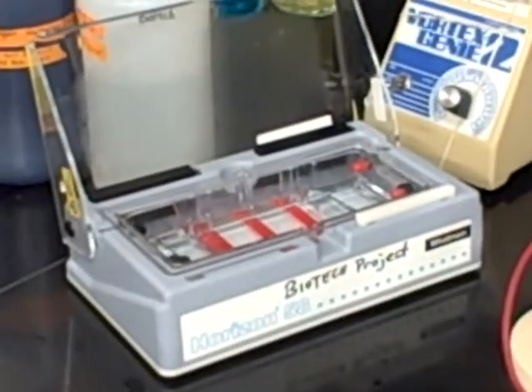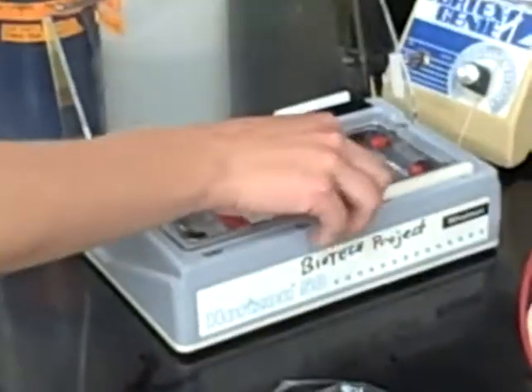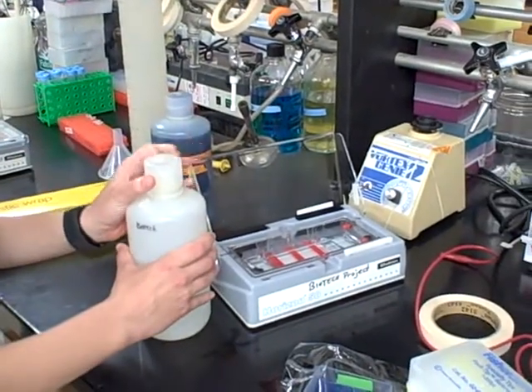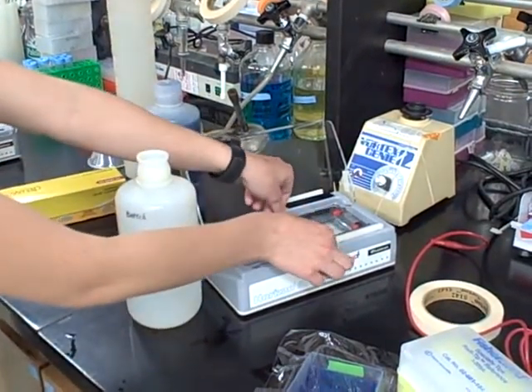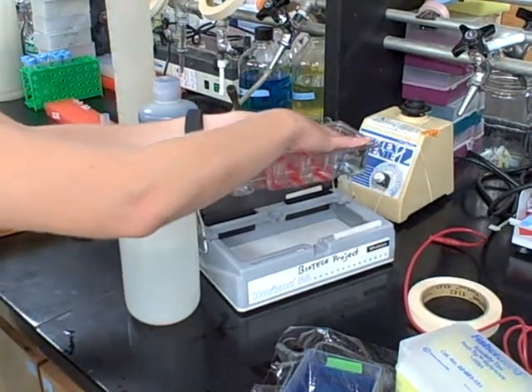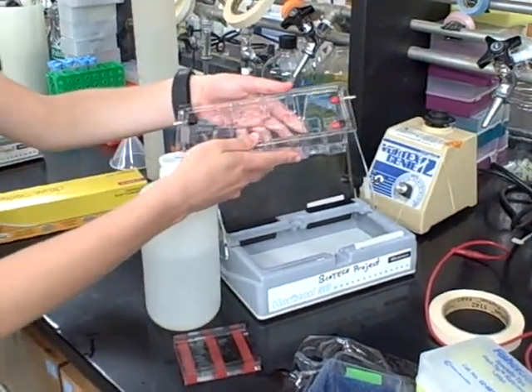The methylene blue should not be reused — pour it into the sink when you are finished with it. The TBE buffer, on the other hand, can be recycled. Just pour it back into the original bottle.